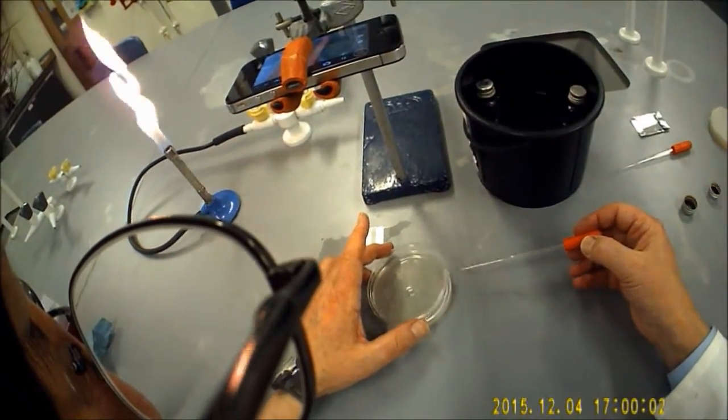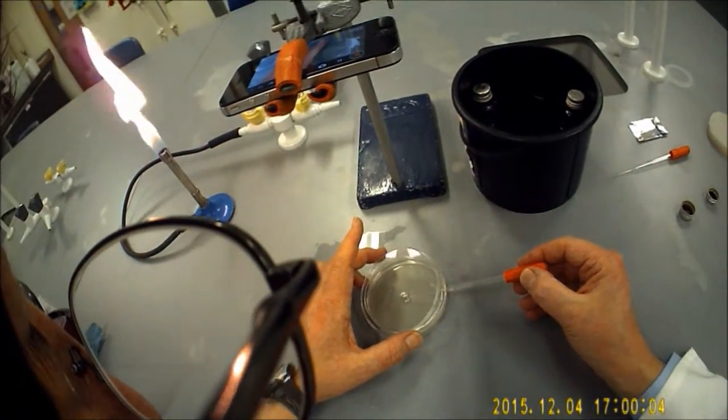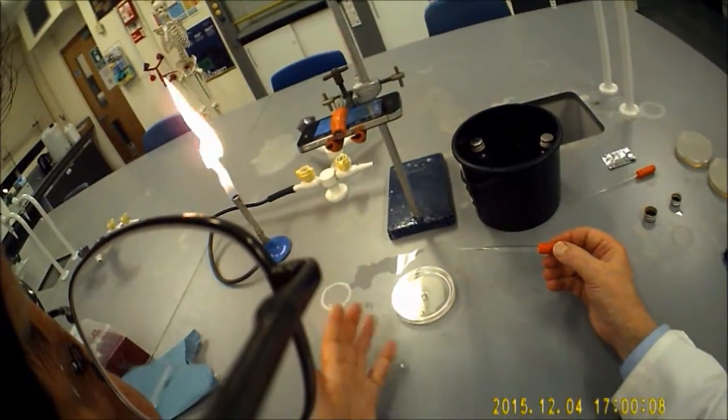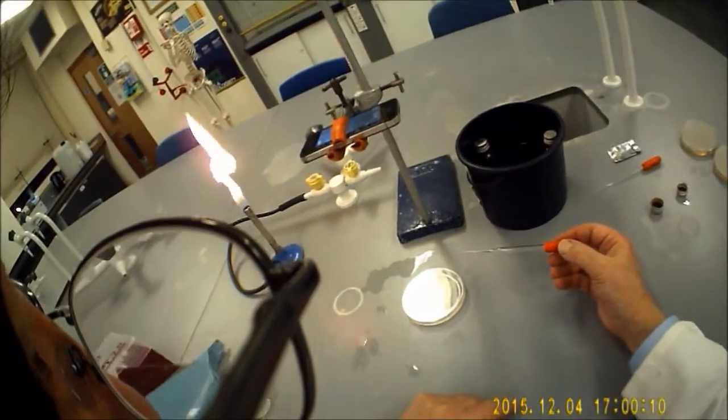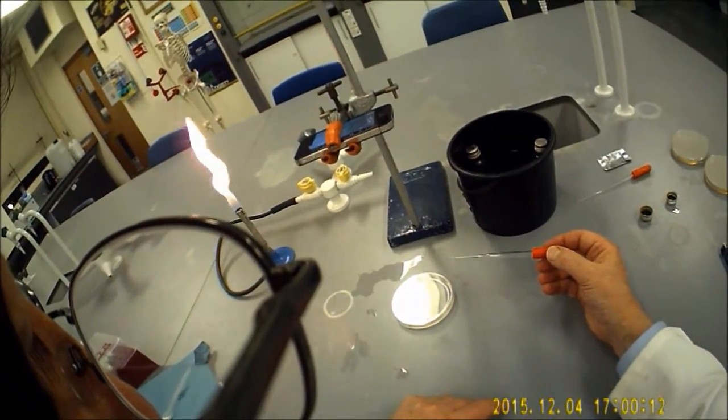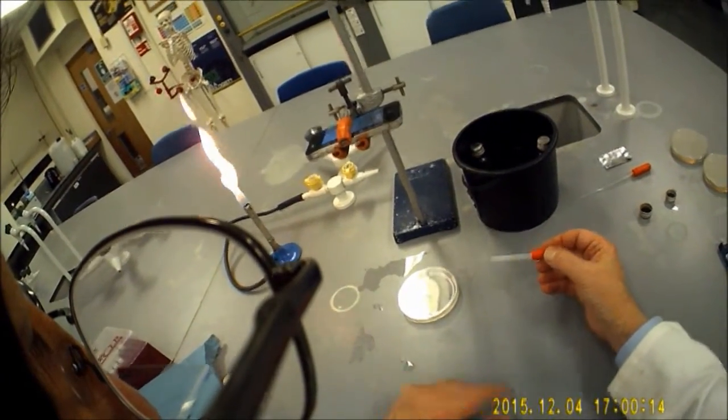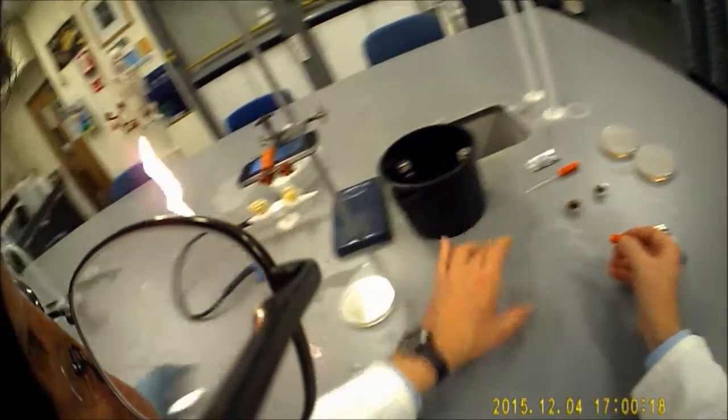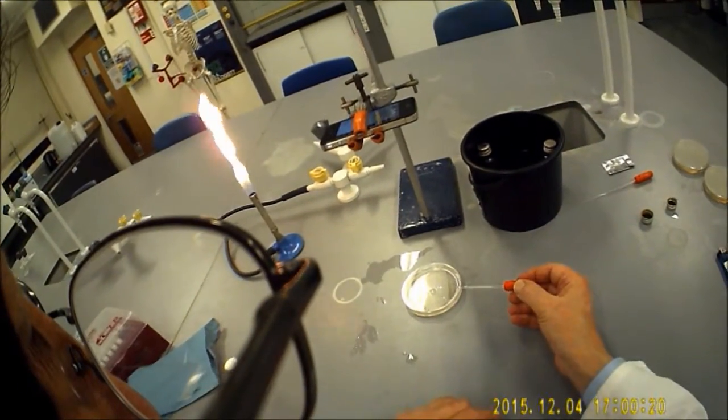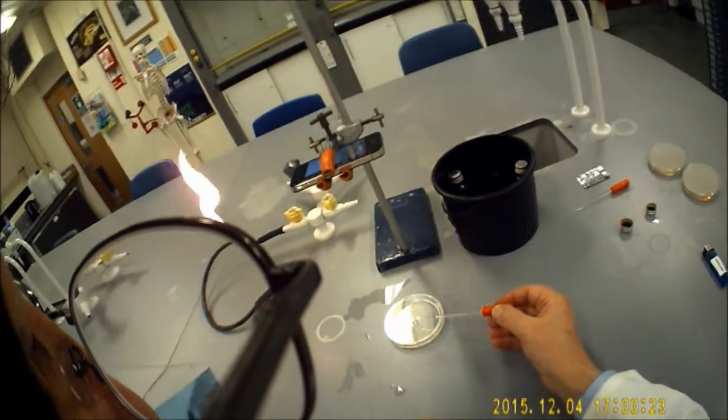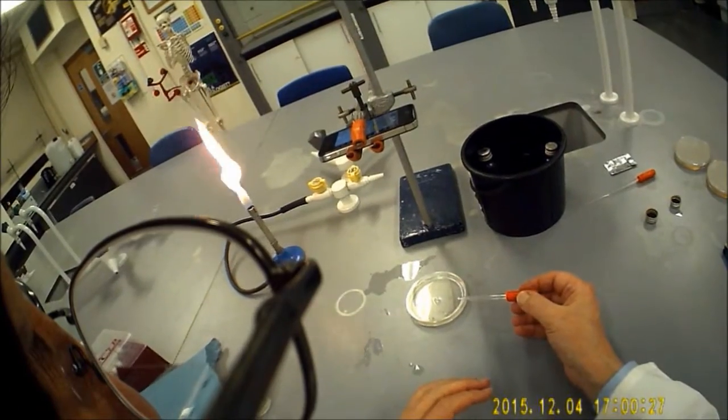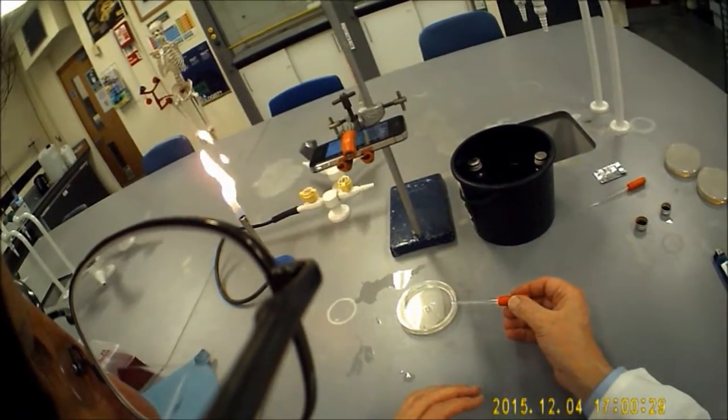And then I'm just going to reach underneath. That's just popped a couple of drops of agar into the bottom of the well. You can carry on with this same pipette topping up as long as you don't touch the material of the agar plate. If you do, you're going to start cross-contaminating, so you need to change your pipette straight away.